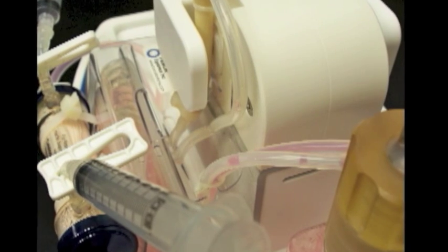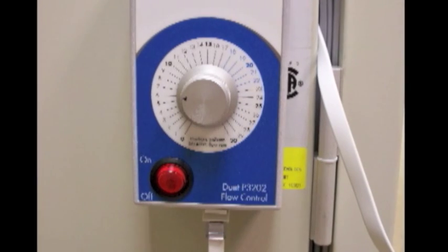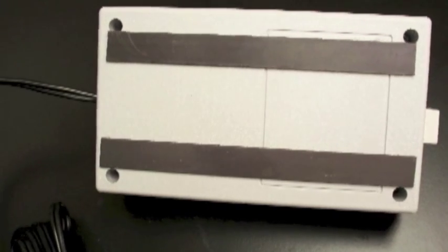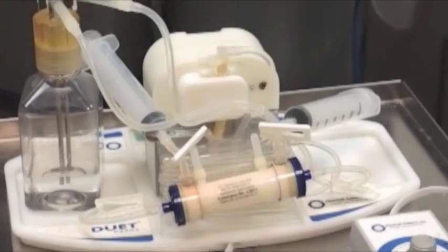The control box is calibrated in degrees, so refer to the manual for corresponding flow rates. Two magnetic strips on the back of the control box allow the control box to be attached to the side of the incubator.